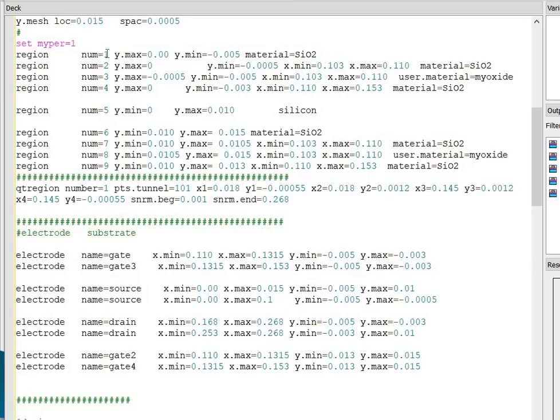Region number 1 with its positional parameter and the material is SiO2. Region number 2 with positional parameter and the material is again SiO2 oxide material. Region number 3 is the user.material. I'm using the user.material my oxide. I have given the name of the oxide in the nanocavity region as my oxide material.